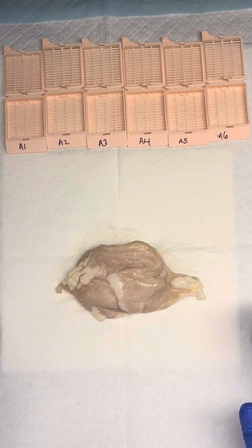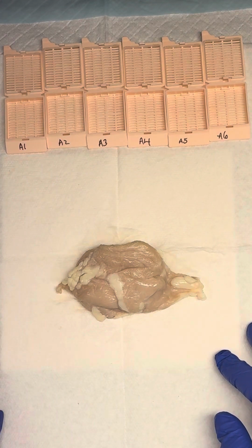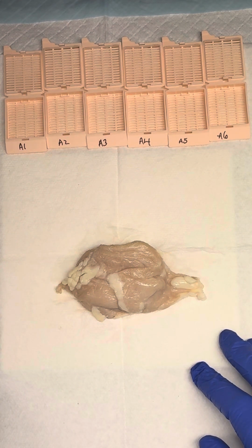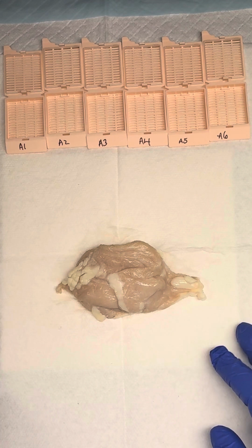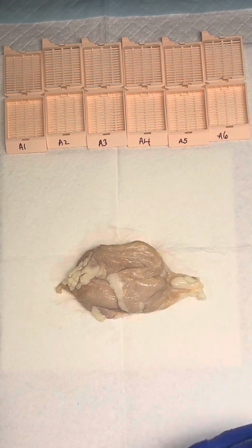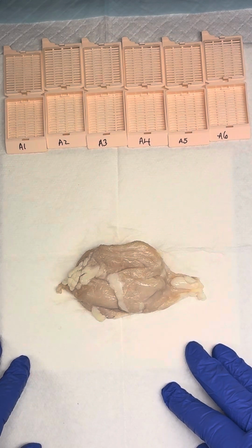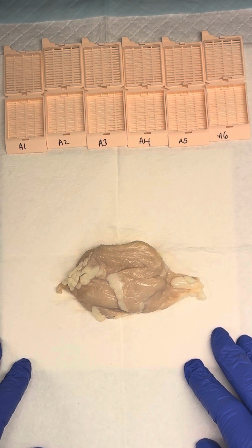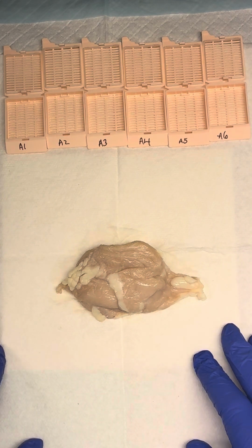Some things that could be adherent. So we know that our thymus lives in our anterior superior mediastinum, right? So the only thing that's anterior to the thymus is going to be our ribs and our sternum. So there's not really going to be any organs that could be attached anteriorly, but on the posterior side, we have lots of structures that could be stuck to our thymus. We have our heart that's directly behind there, so our pericardium could be attached, the pleura, or even the lung. So we want to document and describe anything that's adherent to the outer surface. At this point, we've given all of our descriptions of our outer surface.